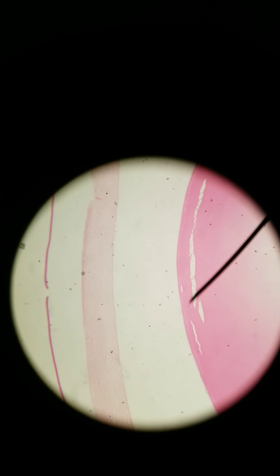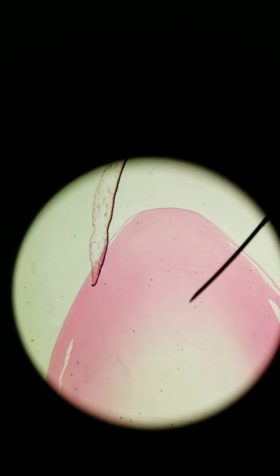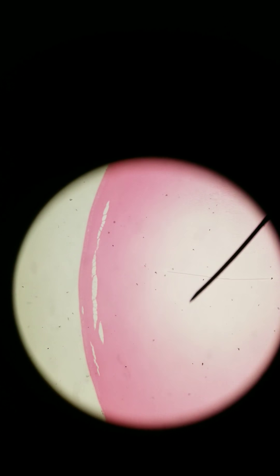Hey everybody. We are looking at the histology of an eye. This eye has been cut — imagine a mid-sagittal cut of an eye. This is the lens, this big round thing. So this is the anterior side, here's the cornea. This is the cornea, the lens, and so the pupil would be in this area.